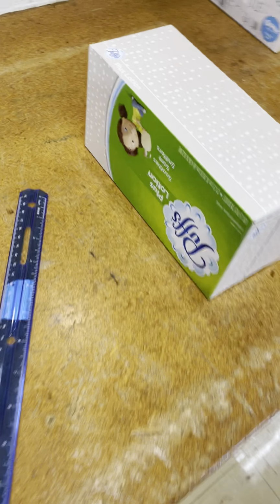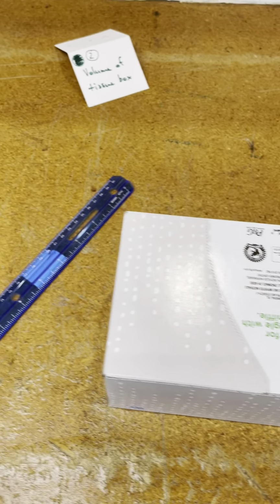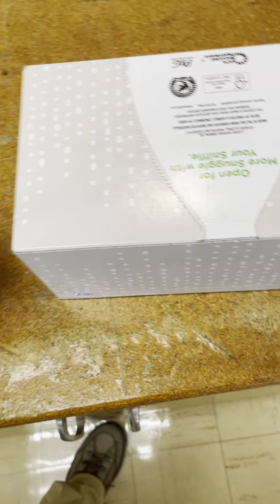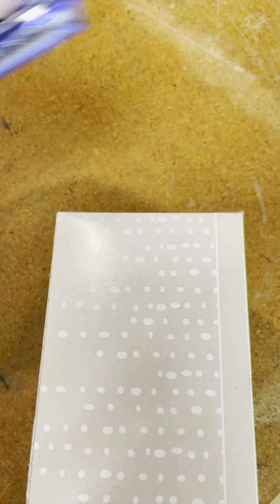Take that off. Station 2, I'm gonna have to explain this a little bit more in detail after a bit here, but actually station 2, where it says volume of the box, here you're gonna do in centimeters, length times width times height. That's this dimension. There we go. One hand is a little more challenging, right? And so length times width times height.